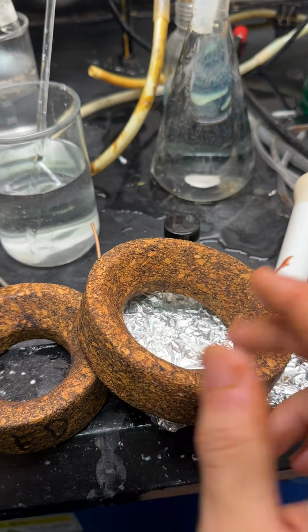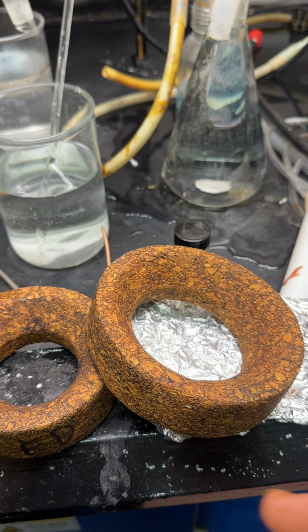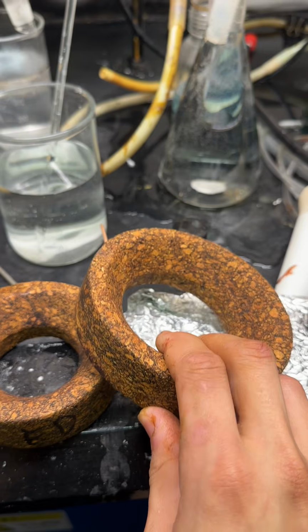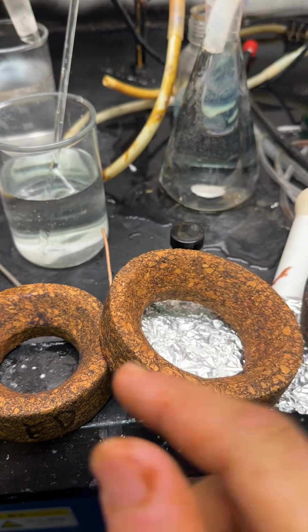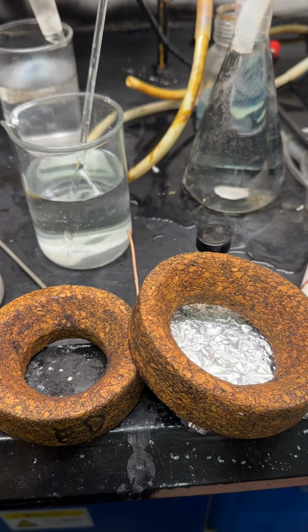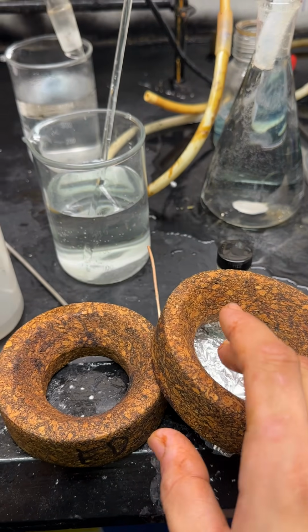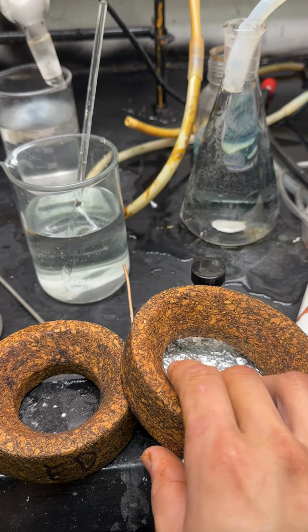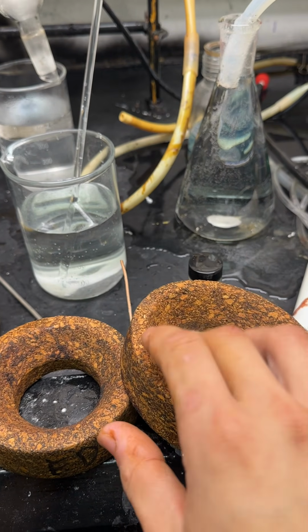And you might be going, well, just make plastic ones. You have a 3D printer, 3D print plastic ones. Plastic melts. I put hot flasks on these. I don't want them to melt. And some plastics like ABS are not very good for solvent. You can use polypropylene, but again, it melts above 100 degrees Celsius, which is not very helpful because I do a lot of high temperature stuff. High, as in over 100 degrees Celsius.